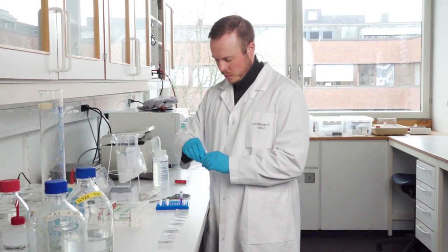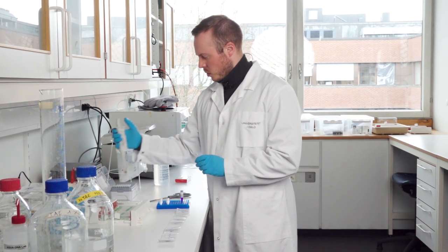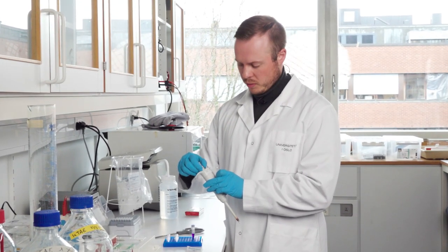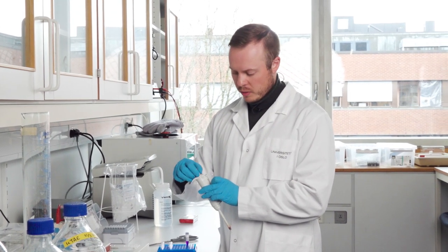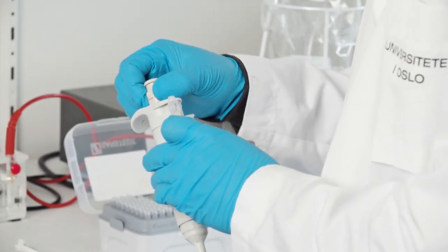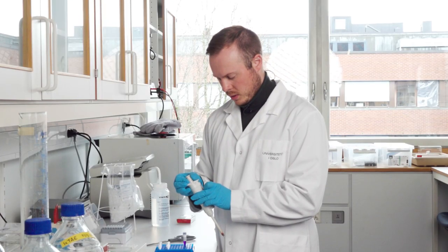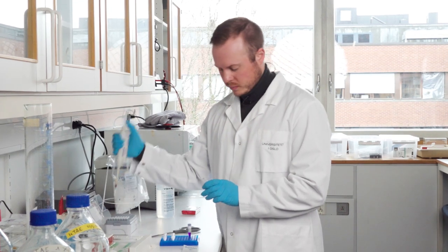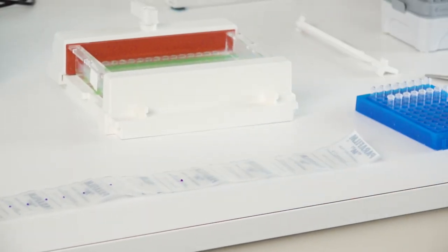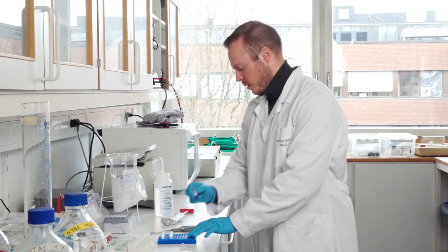And then I also add the ladder as well. And here also this depends a little bit upon which ladder you use. This ladder here you only need around two microliters of it to get a good gel. But some ladders you need more and some even less. So this is something you need to read about. And I like to make this dot a little bit further away so I know it's the ladder. So then this is done.